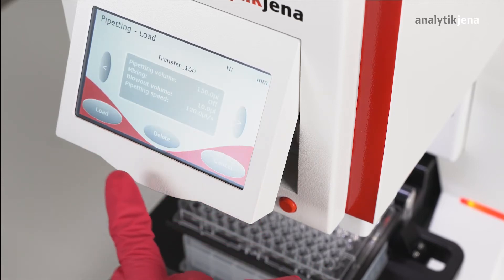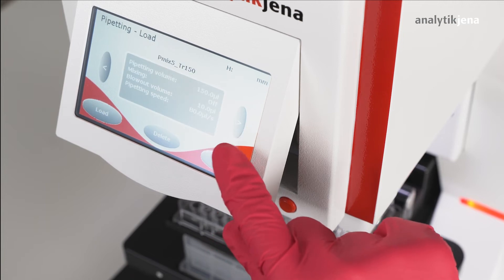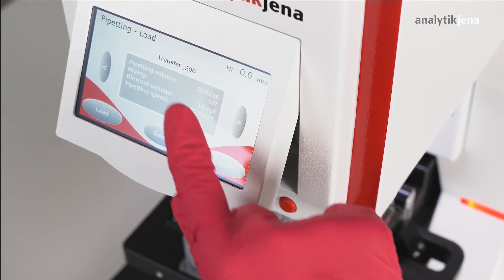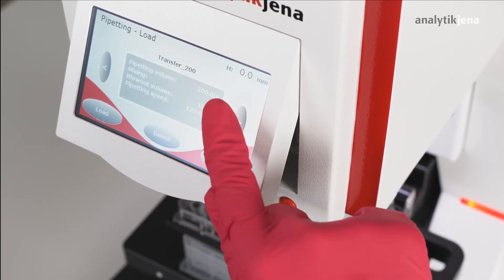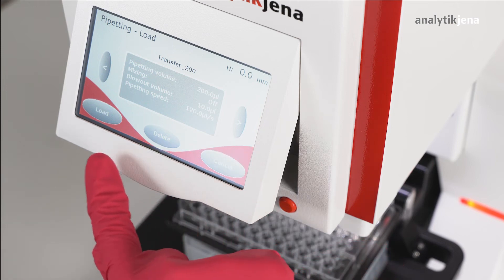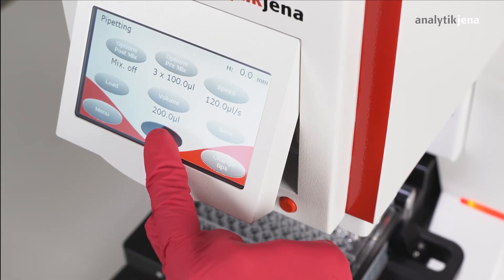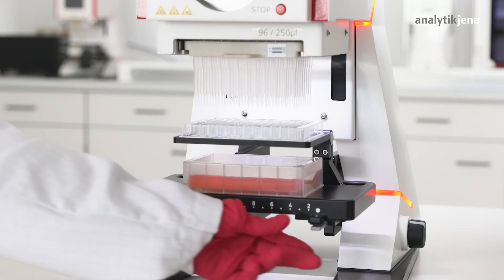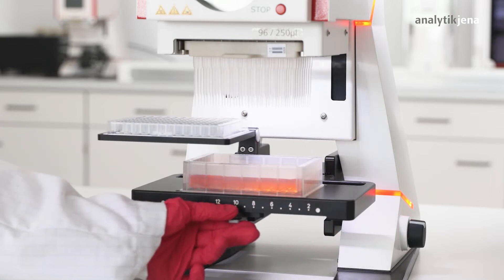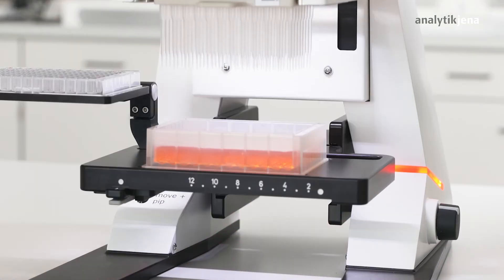Previously saved methods can be selected and loaded. If the user loads the saved method, the pipetting heights are then automatically approached. The move and pipetting button must be pressed to execute the method.